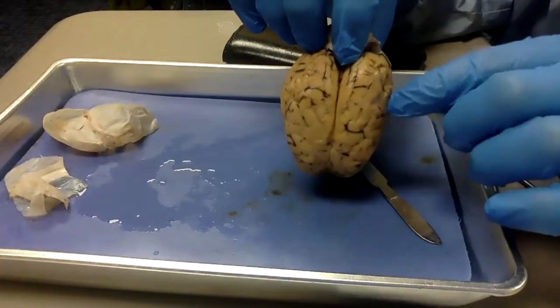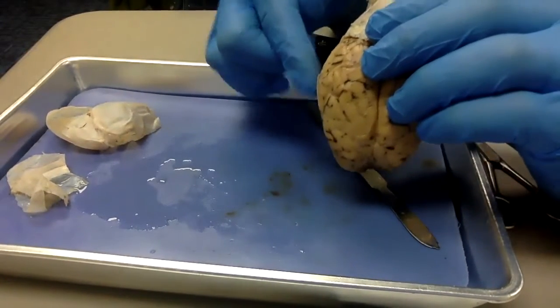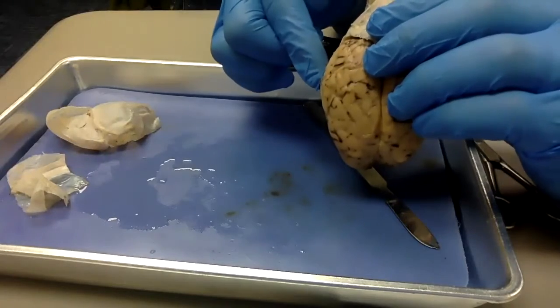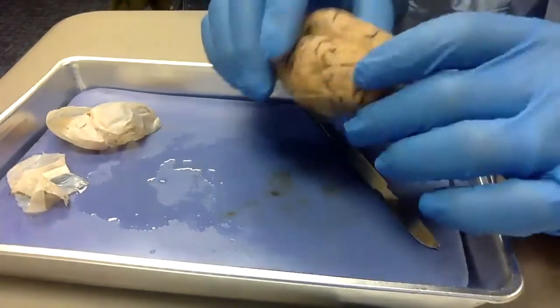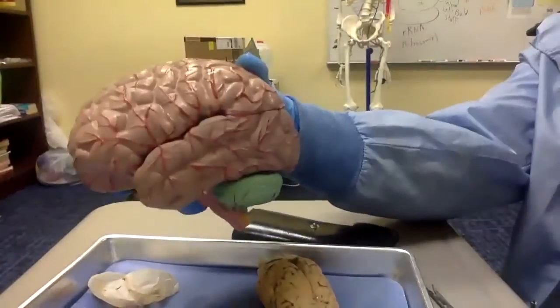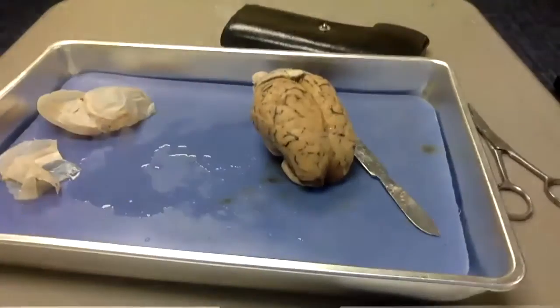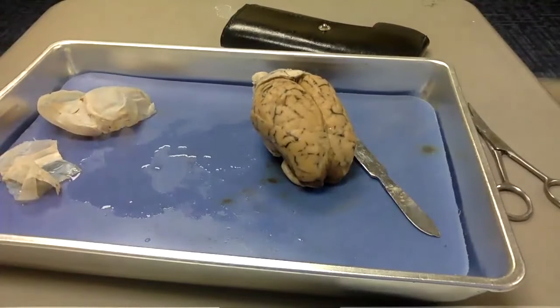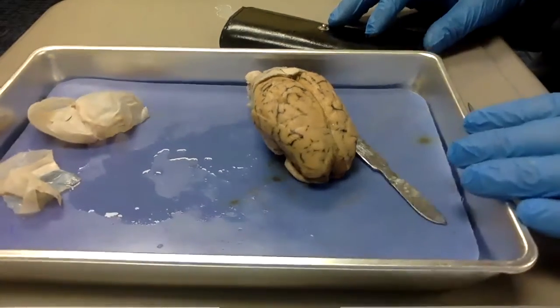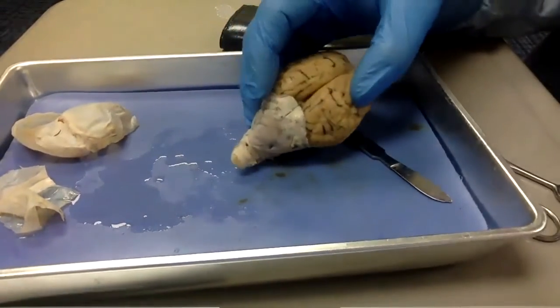You see a bit, actually you see better on this side, a bit of a bump sticking out right there. That is the temporal lobe. And a temporal lobe is a good place to house a whole lot of memories. The human temporal lobe is pretty substantial. It's pretty noticeable. The sheep's temporal lobe, not so noticeable. So again, what does that say about the sheep's memory capacity? Right, not that good. It's not going to have a good job remembering what's going on. Let's continue removing this dura mater.